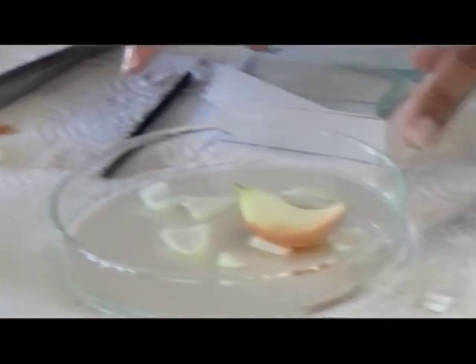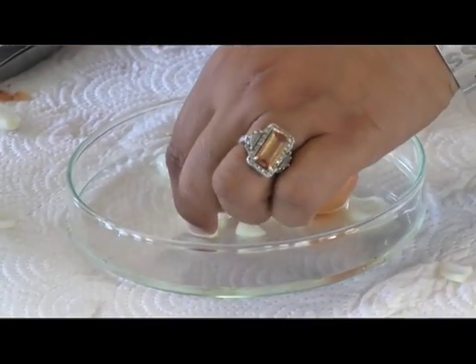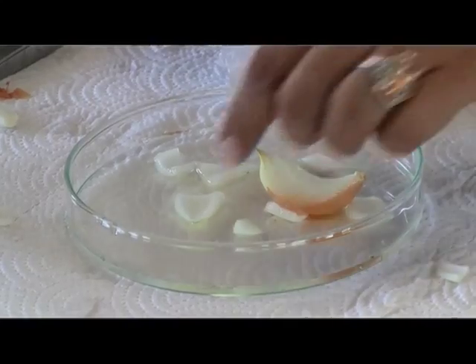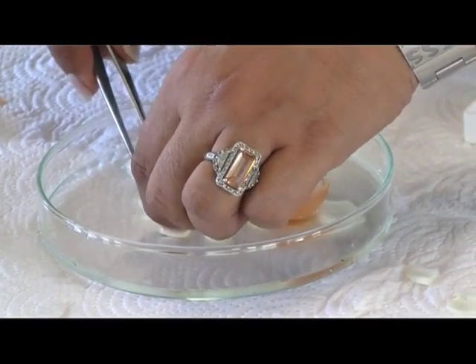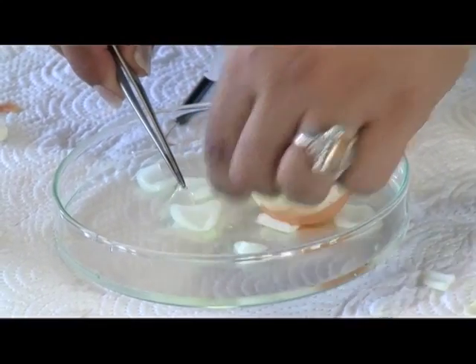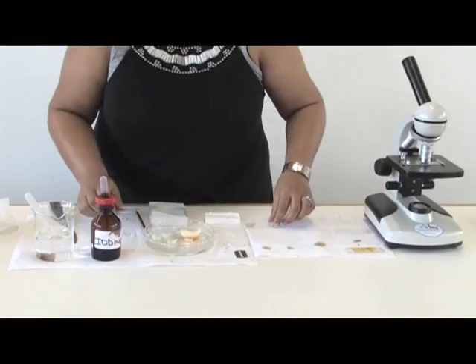I have pre-cut a few pieces of onion. On the inside, it's best to first remove the first three fleshy leaves and then you will get to the thin layer that you can just pull away from the fleshy part.